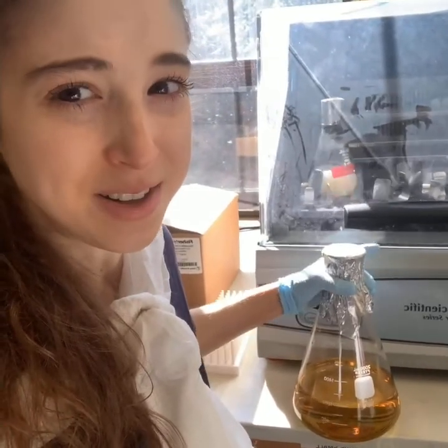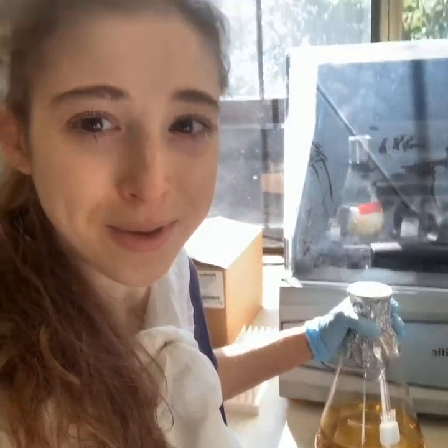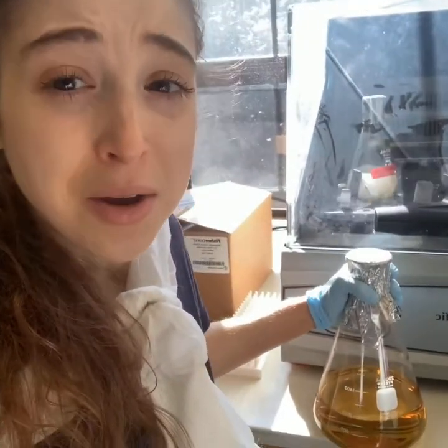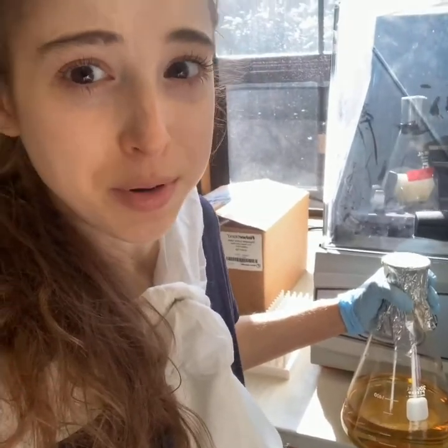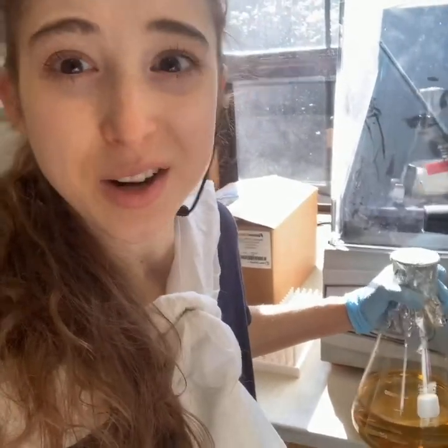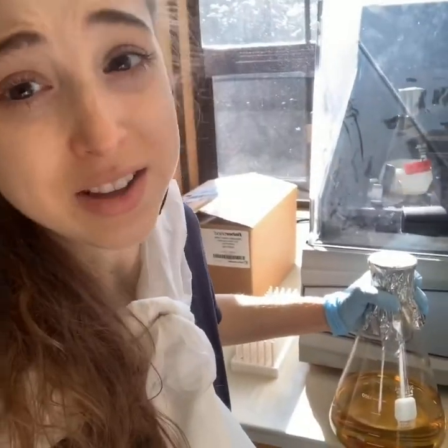Looks like today someone's going to use bacteria to grow some protein for them. We can overexpress proteins in bacteria, which means we can get a lot, a lot, a lot of protein from bacteria, assuming that the bacteria are okay with making it for you.